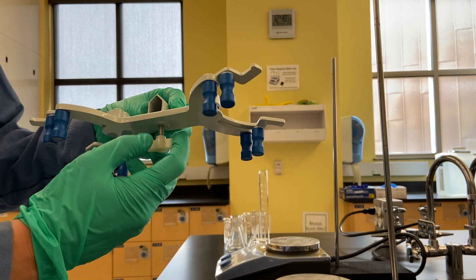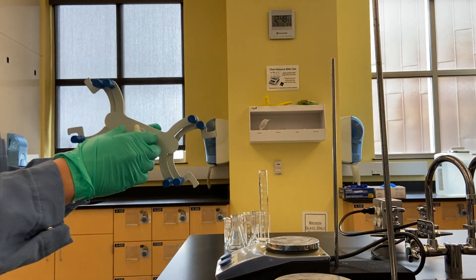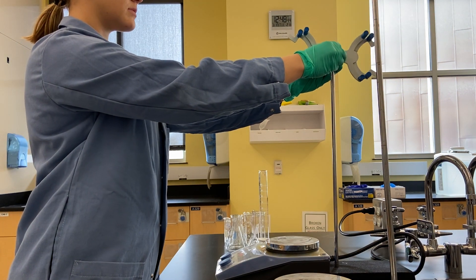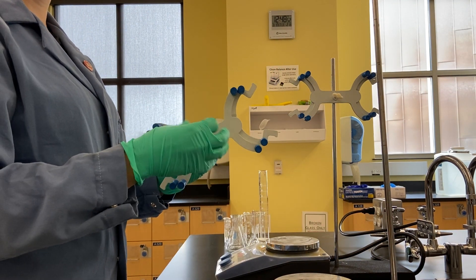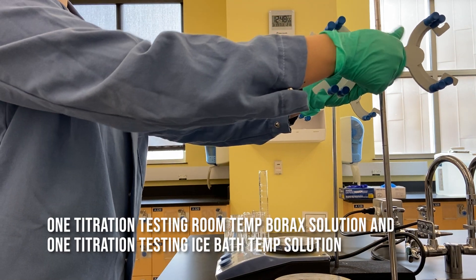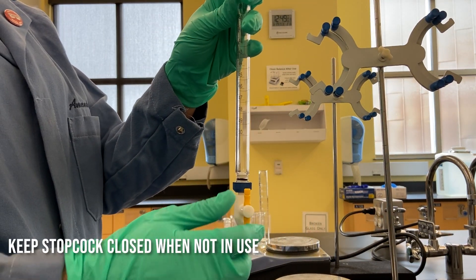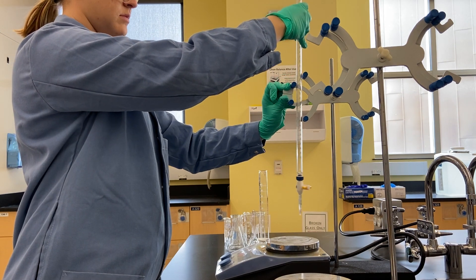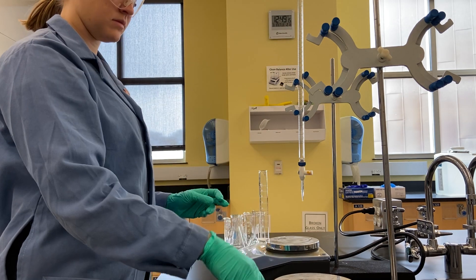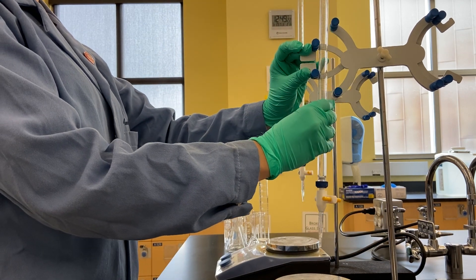We're going to get started with the setup of the experiment. I'll show you how to set up a titration. In my hands I've got a burette clamp for clamping your burette. You're going to unwind the screw in the middle, slide the clamp down the ring stand, and tighten it up. I'm actually setting up two titrations to save time. This is your burette, and this is the stopcock — make sure that's closed, otherwise all of your liquid will run through.